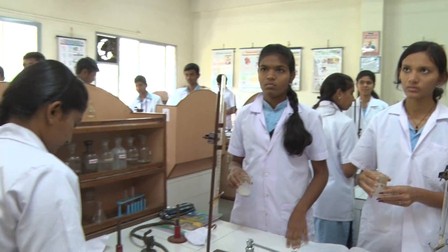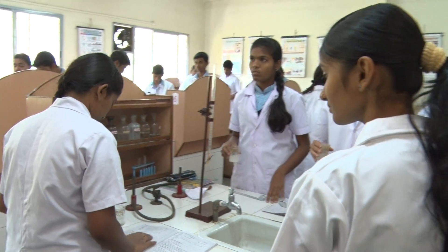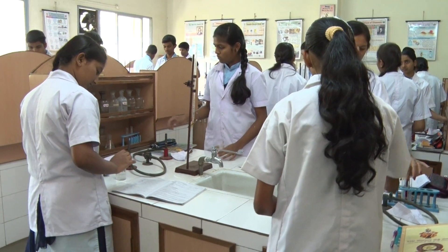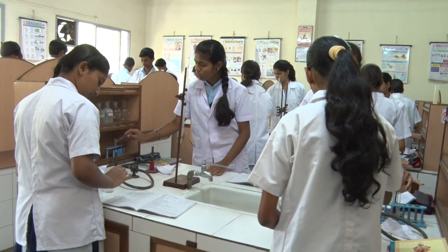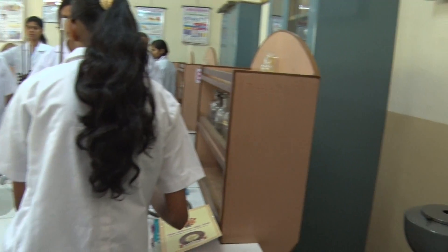It is completely soluble. Take one test tube and perform the test. We are going to perform the test now.